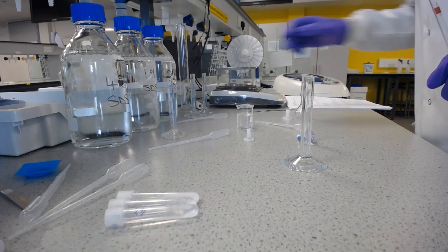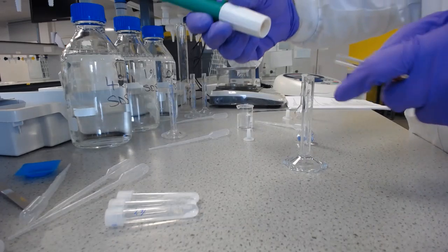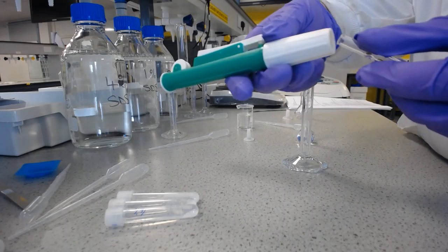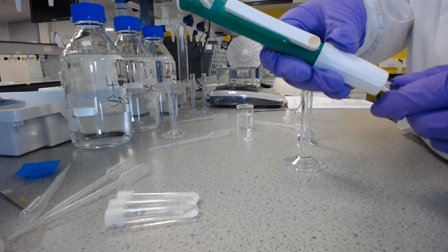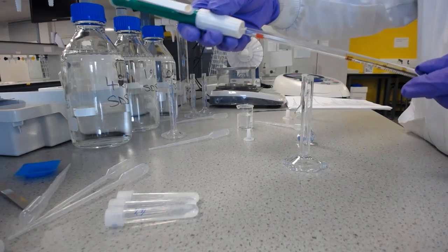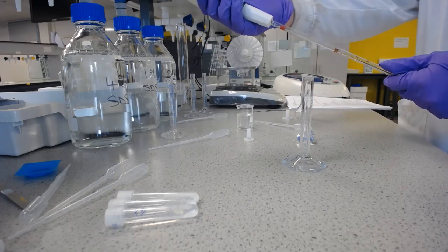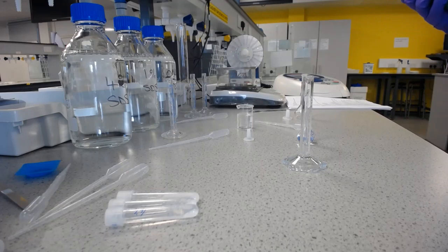So what I'm going to do is use a glass pipette, and remember, when we put these in, we hold the glass pipette as close to the top as we can, and then we secure it in there nice and tight, but we don't push from further down because we can break these very easily, and we don't want to cut ourselves accidentally with them.